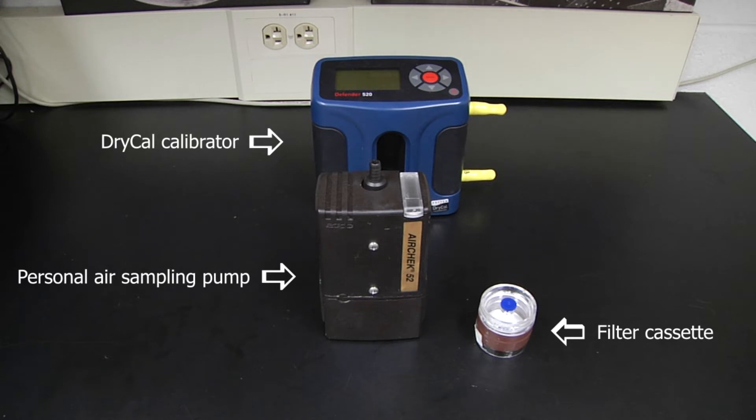I'm going to go over how to calibrate a personal air sampling pump with an electronic calibrator, which is a primary standard.